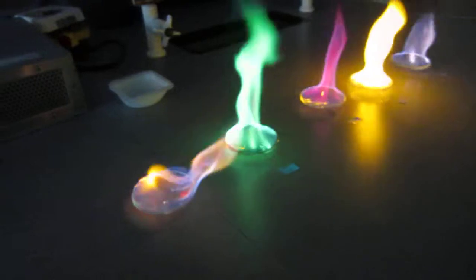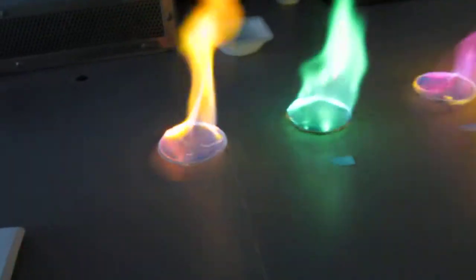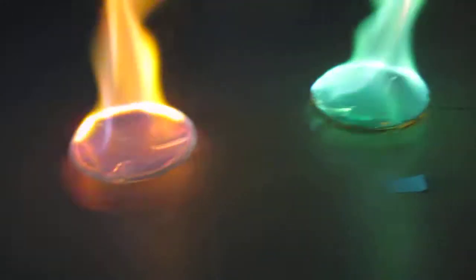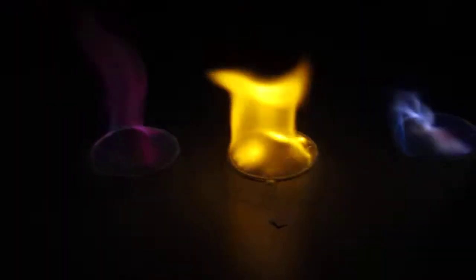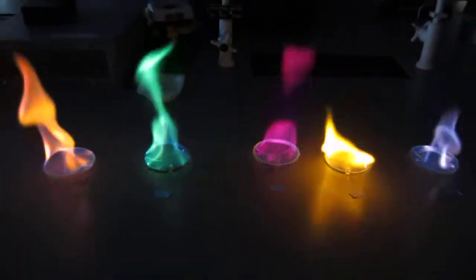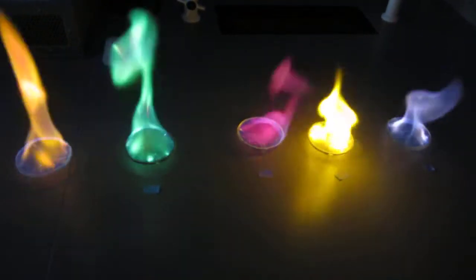I wish we'd put them in order. So cool, but you didn't know what the colors were going to be until you did the experiment. I know, now we have to make a light show. We're going to do a formation.